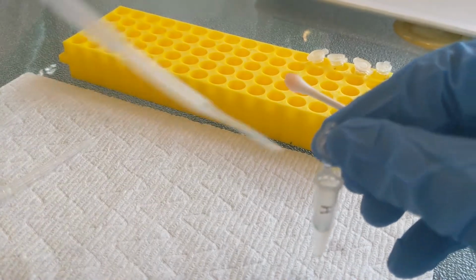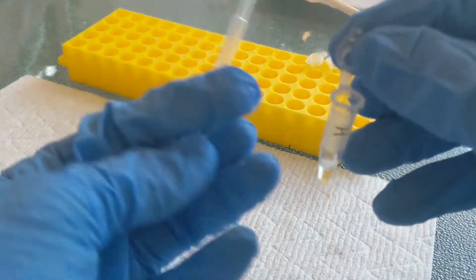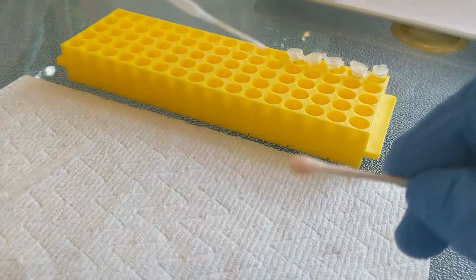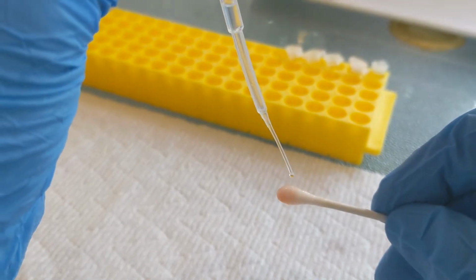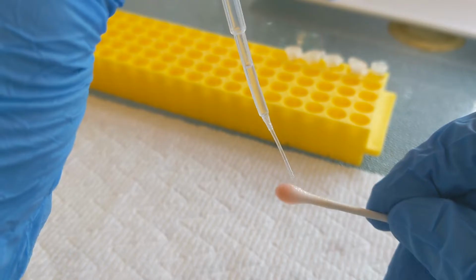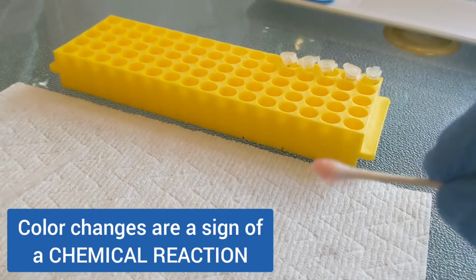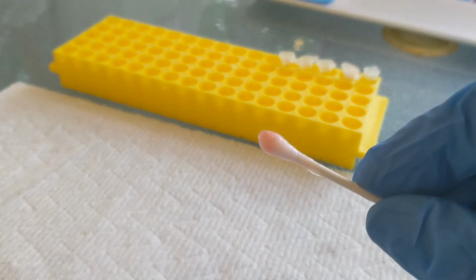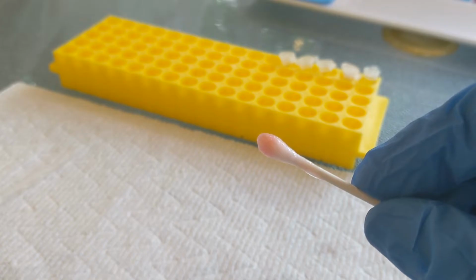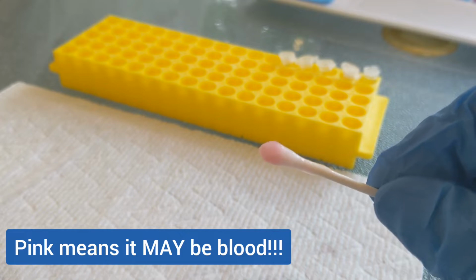And this is the step where if the substance is blood or maybe blood, you should see a color change happen. So what we're looking for is for this to turn sort of a pinkish, pink or purple color. It looks kind of pink. It does look kind of pink. And that's because this is a positive sample. So this could be blood. That's all it means, is that it could be blood.